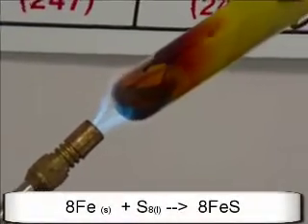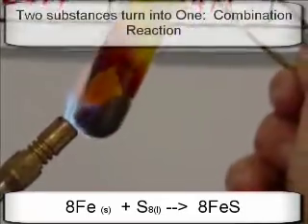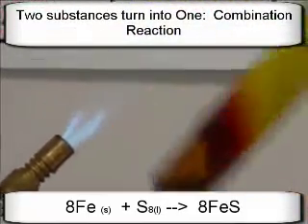How long, Mr. Sams, do you think? Are we good? Oh, I don't know. It's looking pretty reacted to me. There's still a little bit of sulfur at the top, but I think we're good. All right.